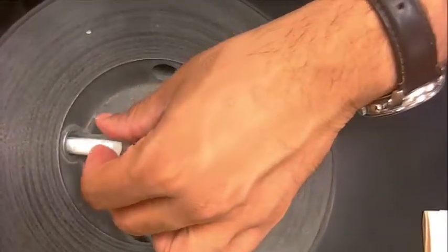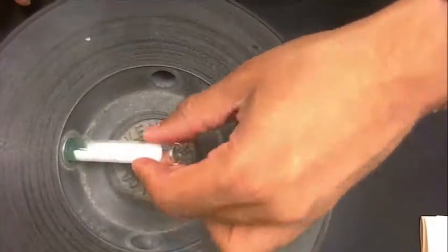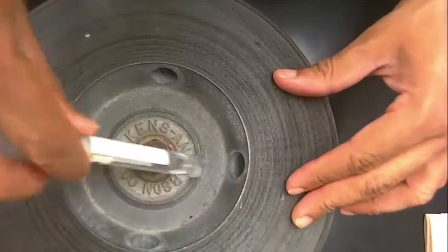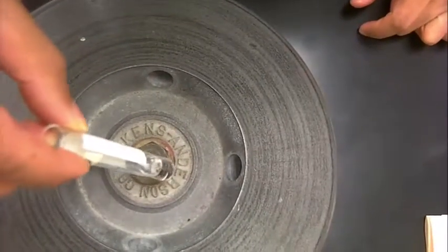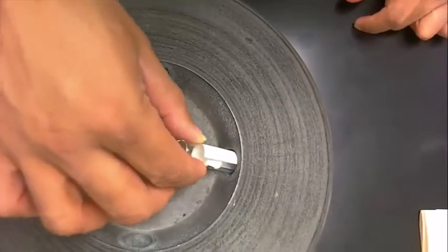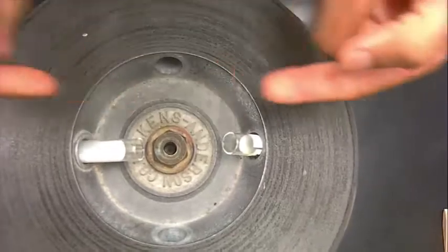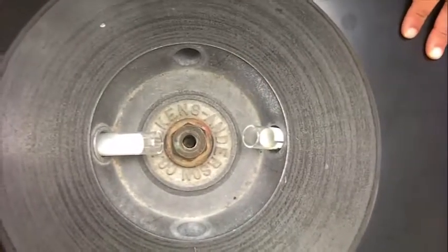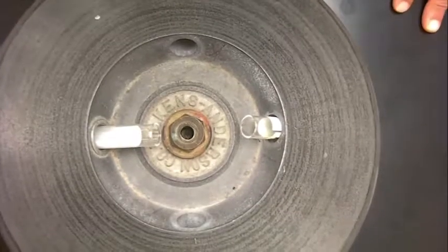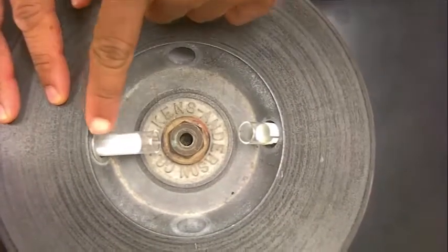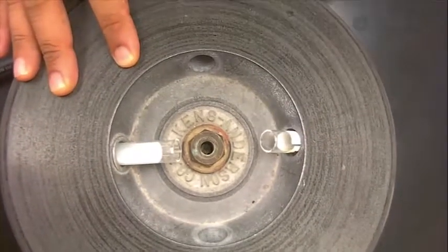If you're going to work with groups, maybe one group will have one reaction, and then the other group serves as a balance. Or if you don't have another collaborating group, you can use water as your balance. But you need to make sure that they are opposite to one another, and they are the same weight. In this case, they're going to have the same volume. This centrifugal force will balance out this centrifugal force.